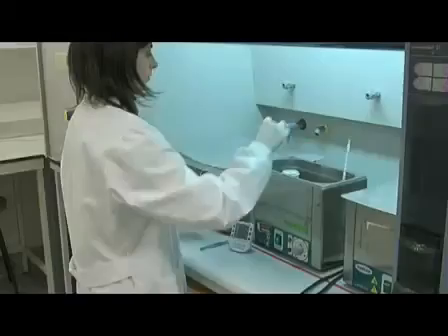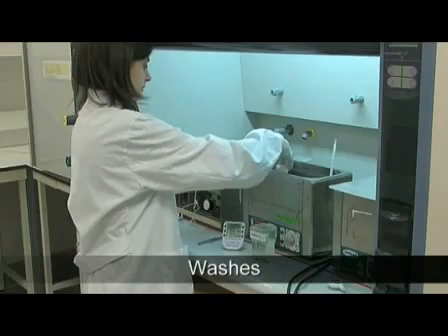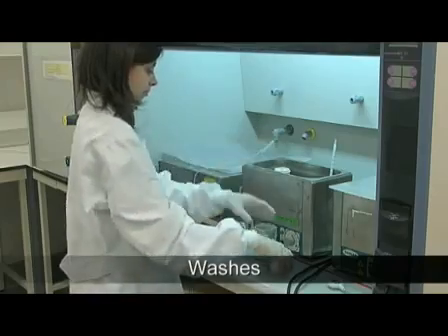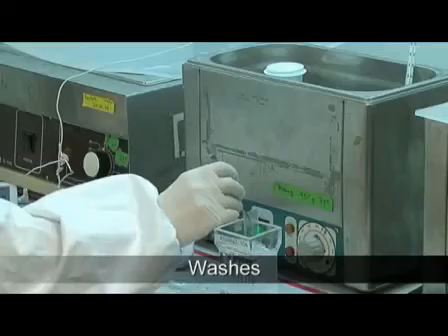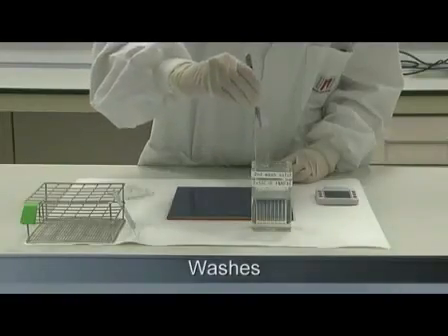It is important to maintain strict control over the time and temperature of the two post-hybridization washes. A higher temperature, or an excessive wash time, can result in the elimination of some signals, whereas the opposite would not eliminate unspecific signals.